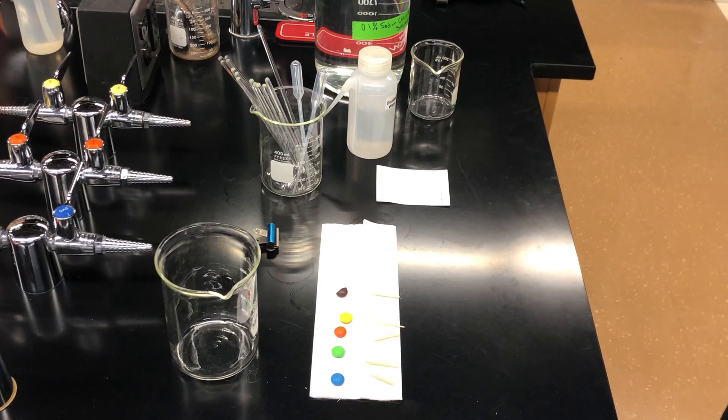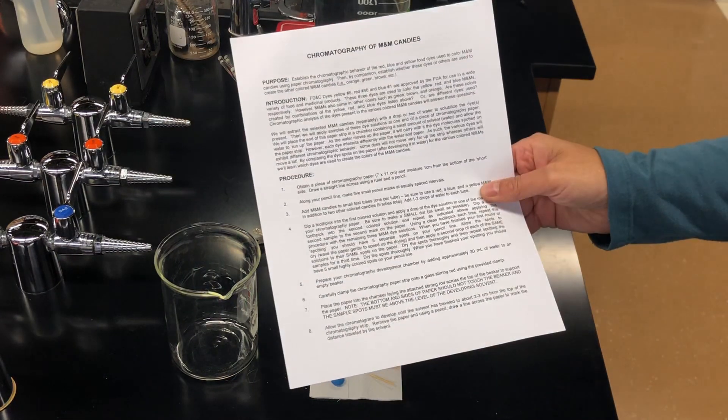All right, I'm going to demonstrate for you the chromatography of M&M candies. I do have the instructions, which you should also have.